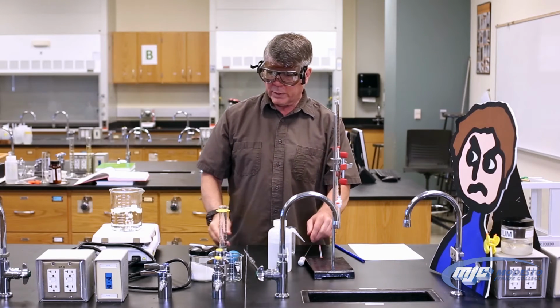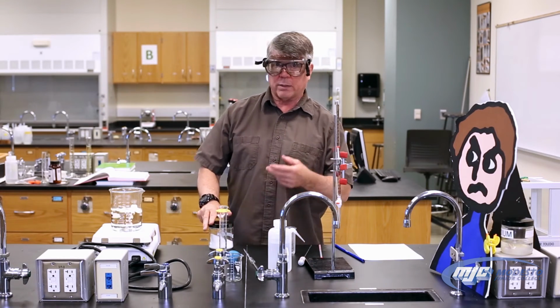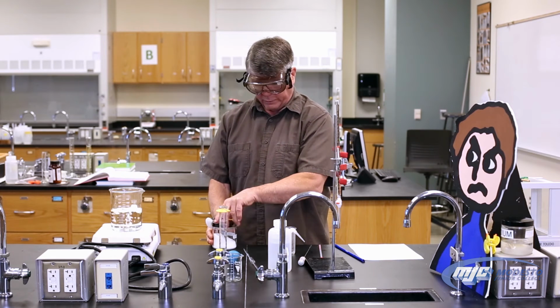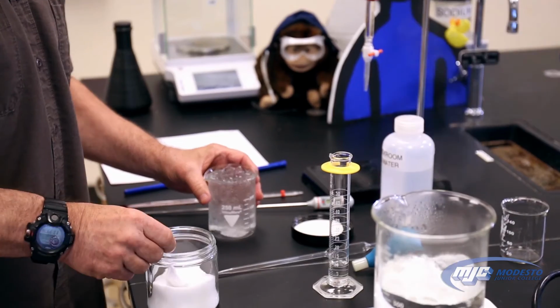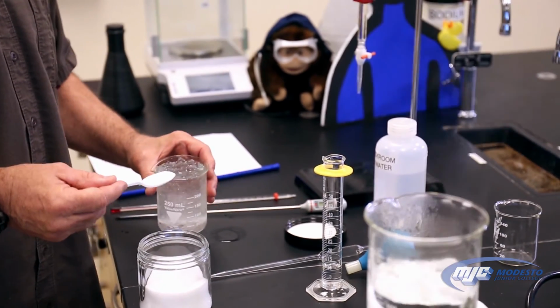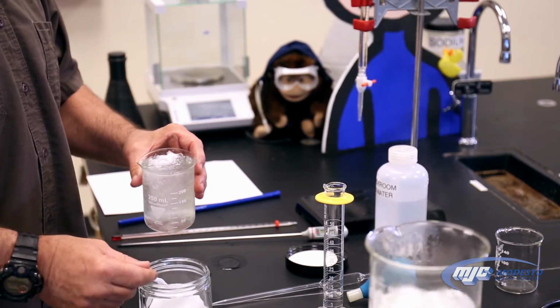Once we get those, we're going to add a little bit of salt. Now, what salt does is it lowers the freezing point of the ice, which means that we expect it to be a little bit colder. We don't have to measure this out carefully. There's a plastic spoon here. Just take a scoop, dump it in. We can even put a little more if we wanted to.